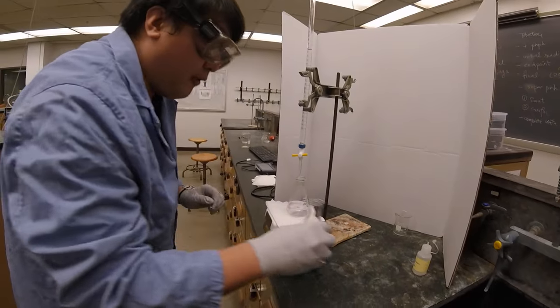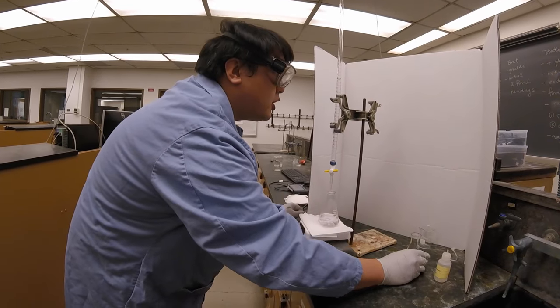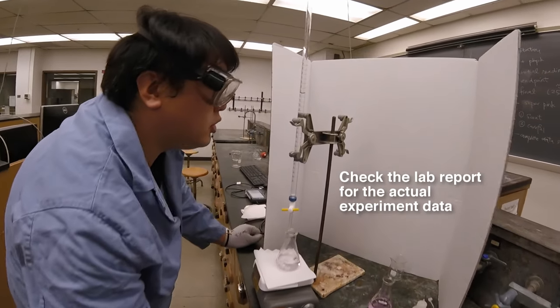Right now, the volume reading for this titration, the final volume, is 30.20 milliliters.